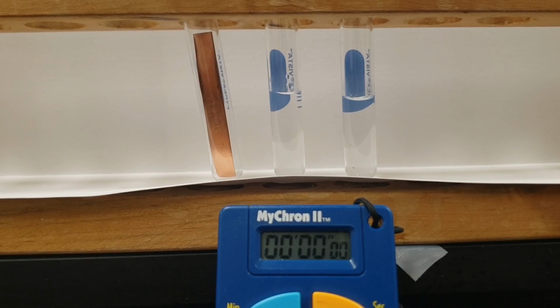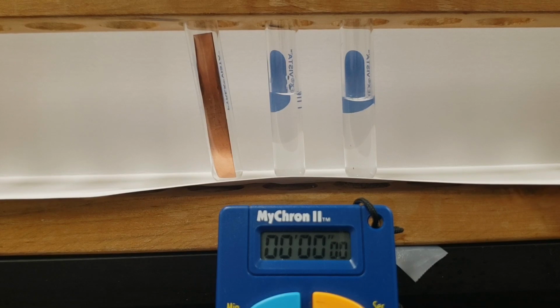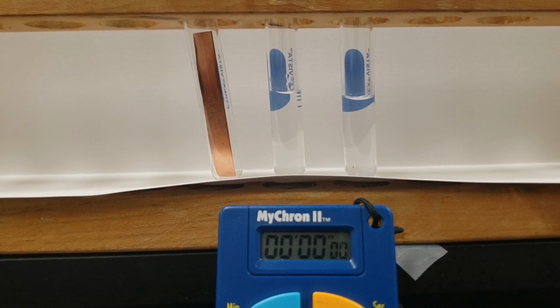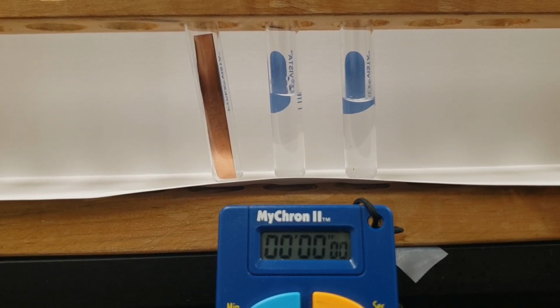while the center one reacts with the copper. So I'm going to go ahead and add that strip of copper to the center one, and then I'm going to turn on the timer just so that you can see how long this takes, because I'm probably going to speed this video up a little so you can see this reaction happen to completion without having to wait so long. But just to give you an idea of how long this really is taking, I'm giving you that timer down below for reference. So here we go.